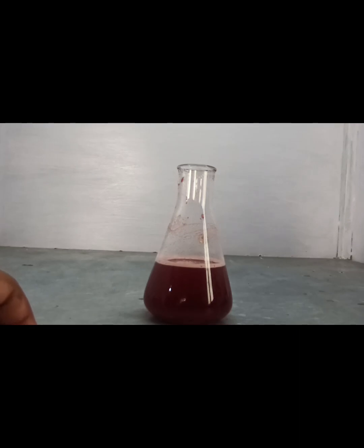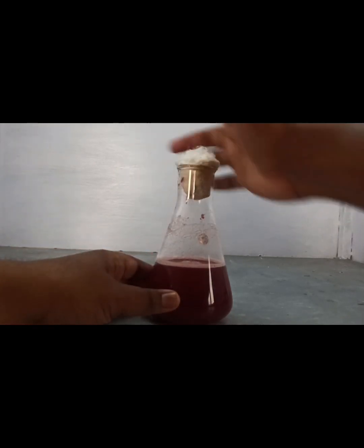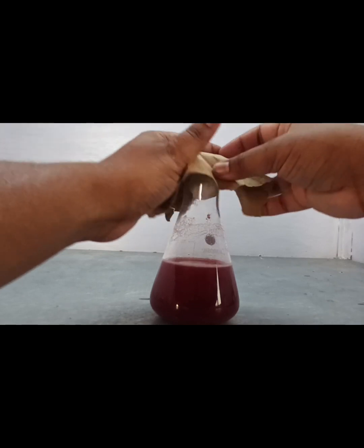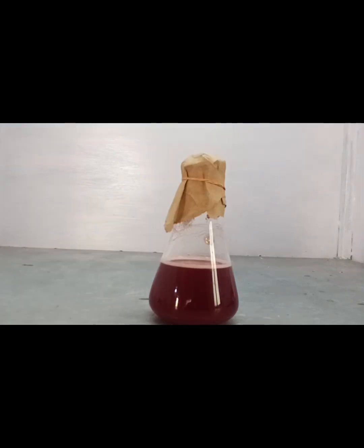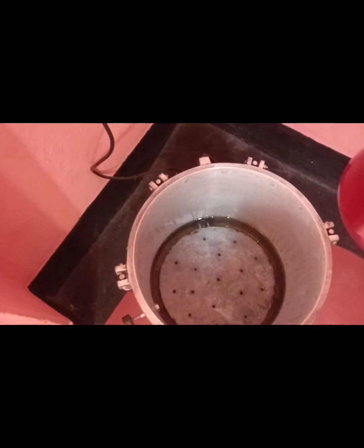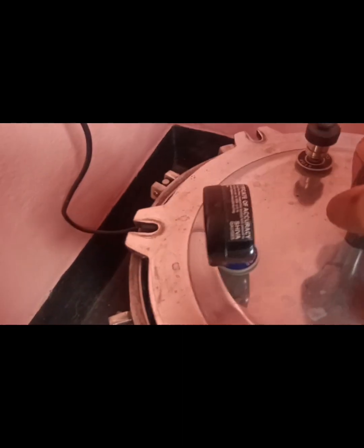After complete dissolving of the agar powder in sterile distilled water, we have to plug the flask with cotton and cover with a paper like this. Tie with a rubber band. After that, it is placed inside the autoclave and the autoclave lid is covered.